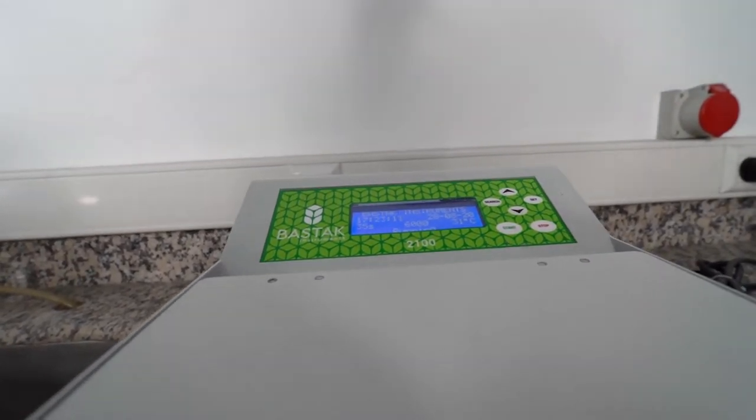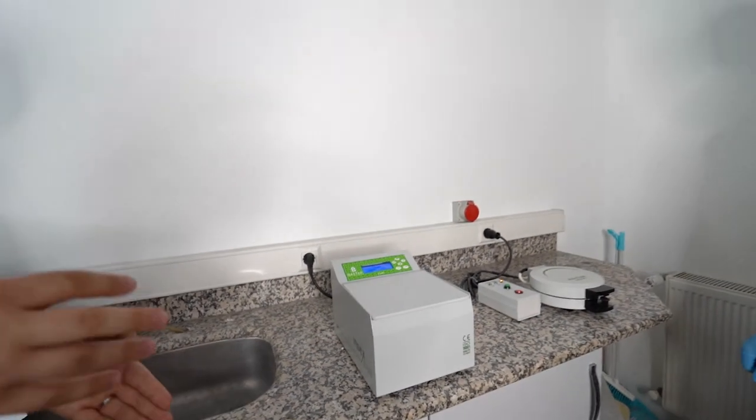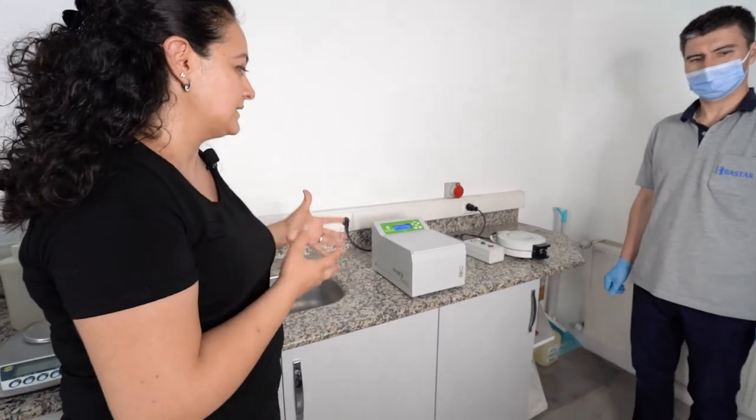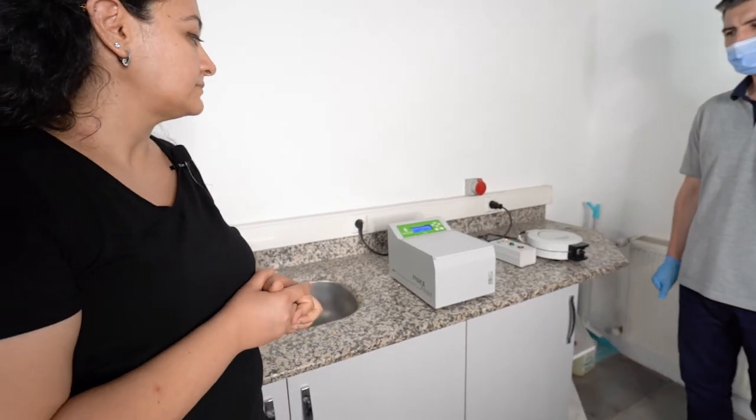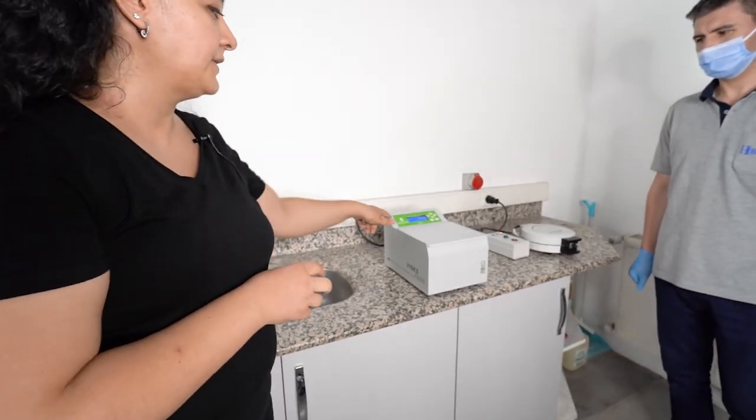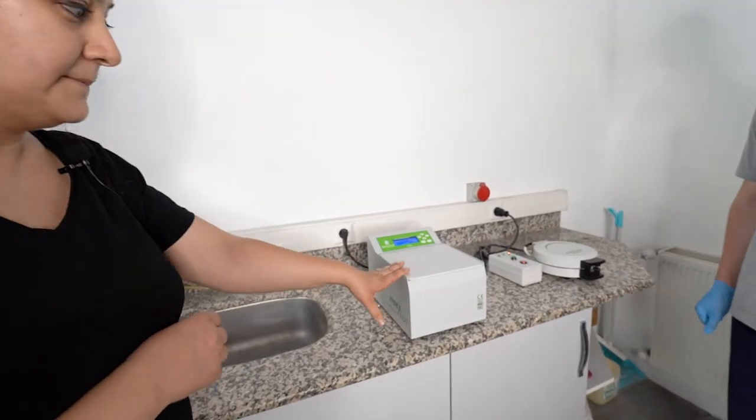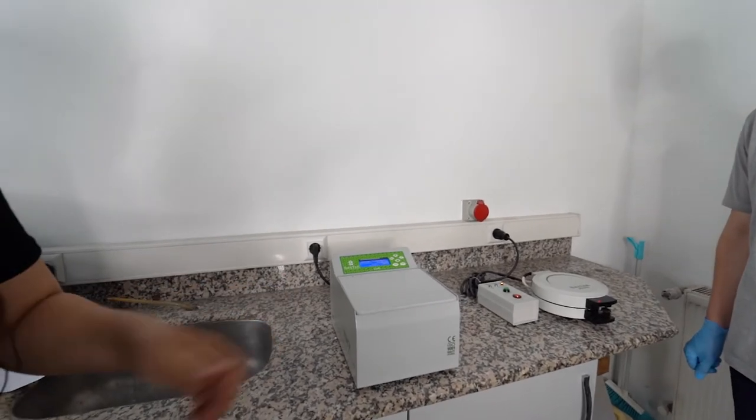Important point: you should put your samples in balance. If you don't put the sample in one of the cartridges, it makes lots of noise and it can be broken. Now it is running, showing on the screen. At the end of the test it gives an alarm. Test completed for index machine.